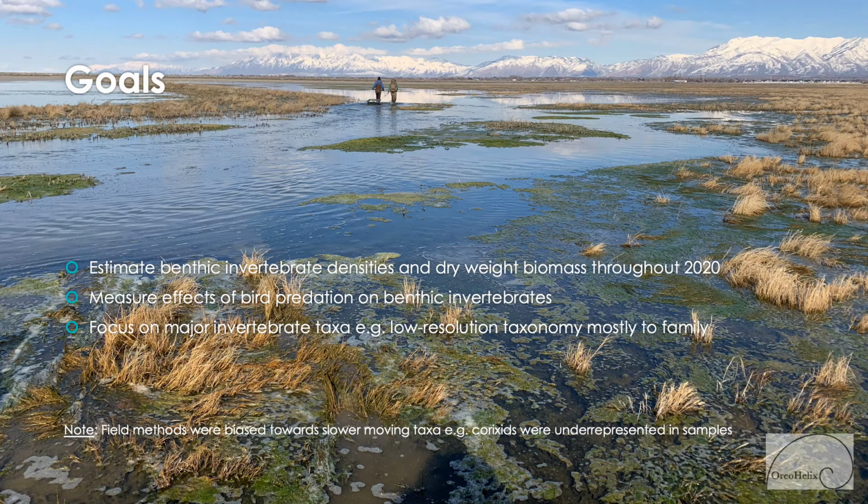Goals of this portion of our study were to: 1. Estimate benthic invertebrate densities and dry weight biomass in Farmington Bay wetlands throughout 2020. 2. Measure the effects of bird predation on benthic invertebrates. 3. Focus on major invertebrate taxa with low resolution taxonomy, mostly to family taxonomic resolution.